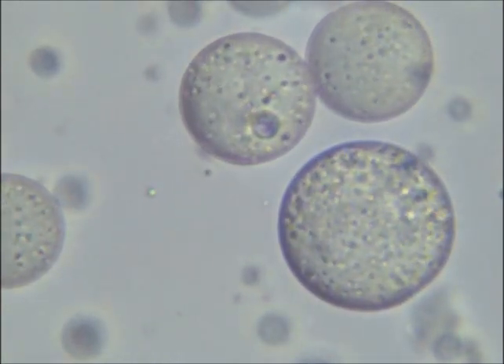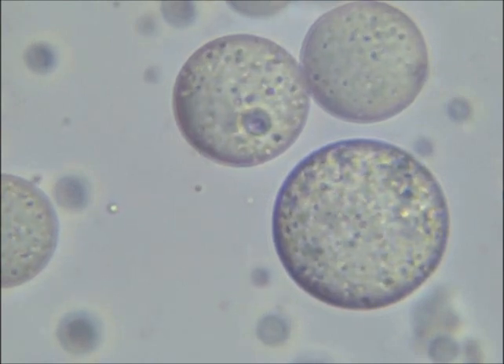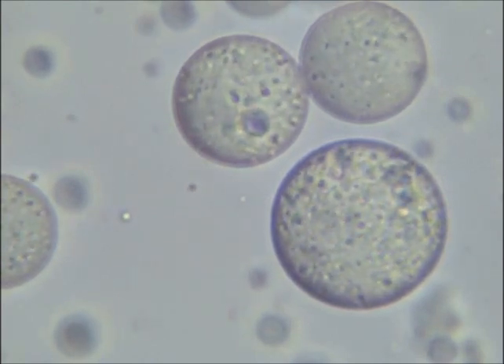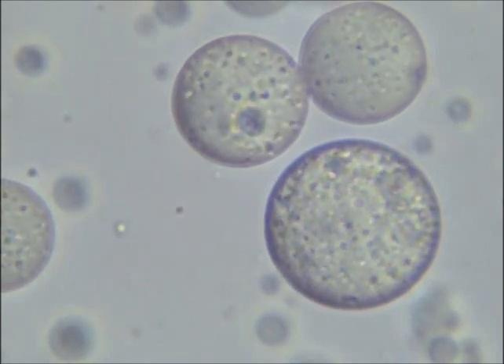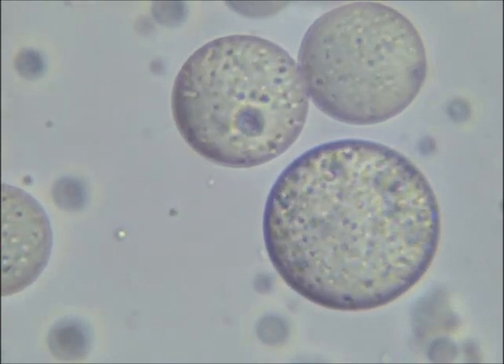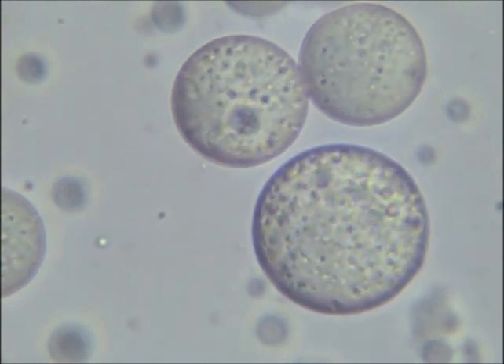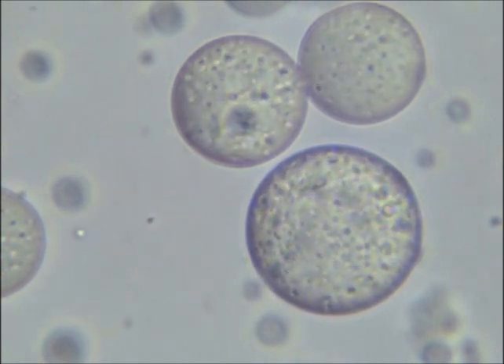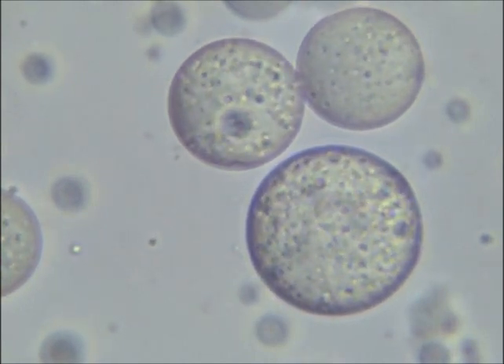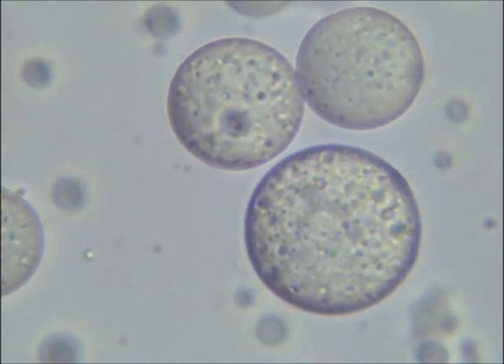This newest and last video of fatty acid vesicles is of a simple fatty acid solution mixed with distilled water. And as you can see, there are more purple vesicles inside of the larger ones. Since I did not add any hematoxylin stain this time, it can't be that the smaller vesicles are stained, and it is likely due to chromatic aberration.